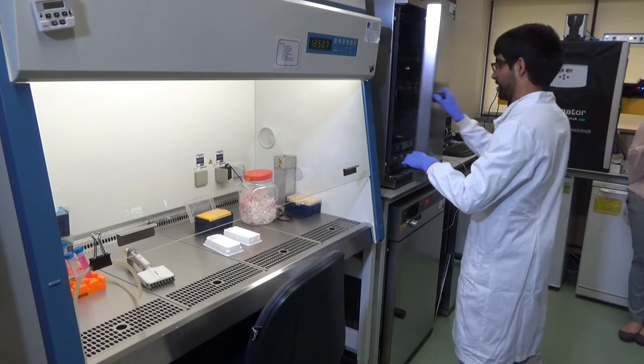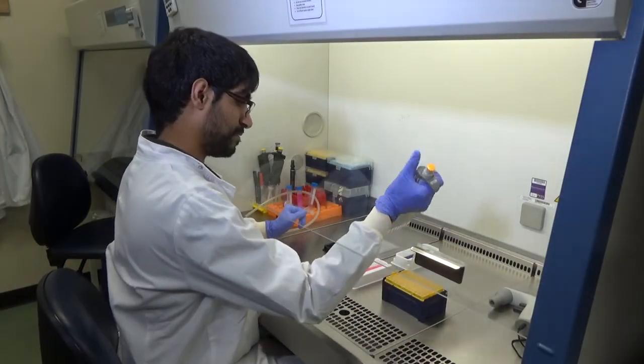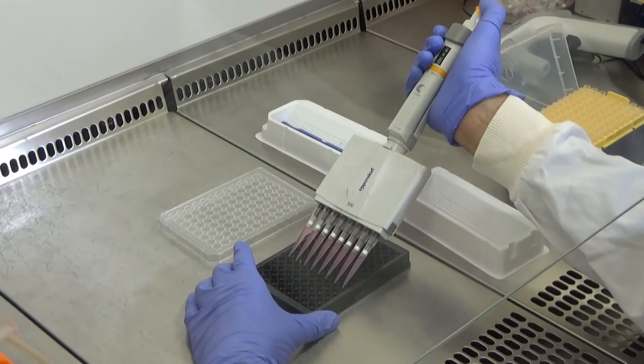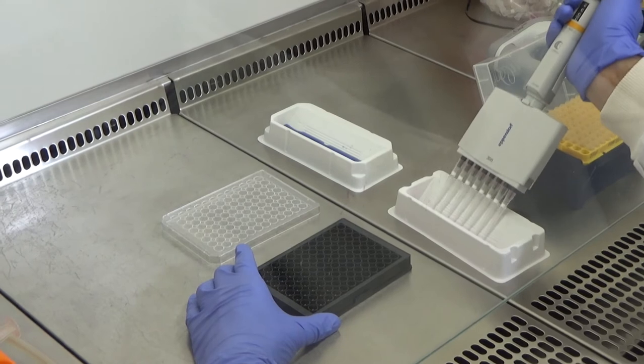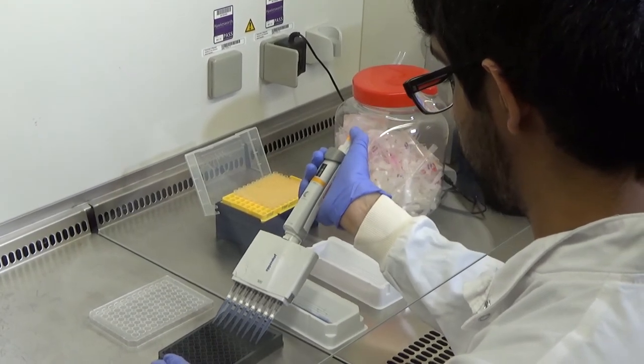Cells are incubated in a 96 well plate with a clear bottom. We then put our cells in the presence of our nanoparticles and incubate them for 24 hours. And then prior to imaging, we stain the nucleus with a fluorescent dye, DAPI.